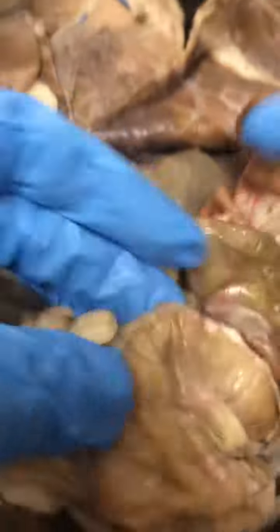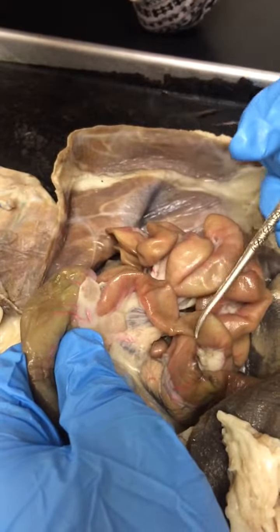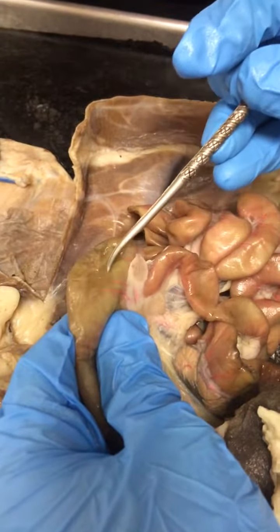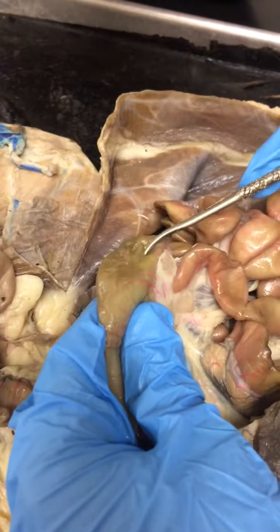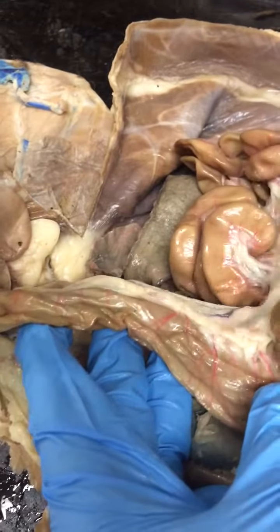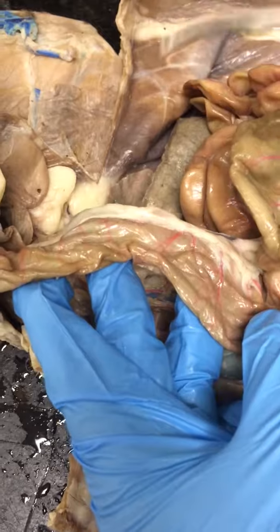Moving further down, the small intestine. Okay, so you can see here's where the small intestine ends. All of this ending area is going to be known as the ileum, where it connects to the large intestine right here. Okay, that is the cecum, right? So ileum is the ending of the small intestine. Cecum is the starting of the large intestine, all right? And then going further down, we know this area that's after as the colon, all right? Large intestine, colon, it's the same thing.